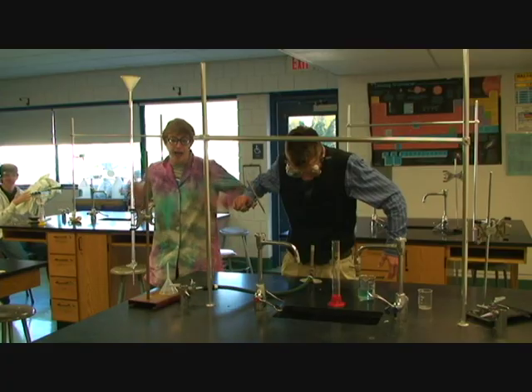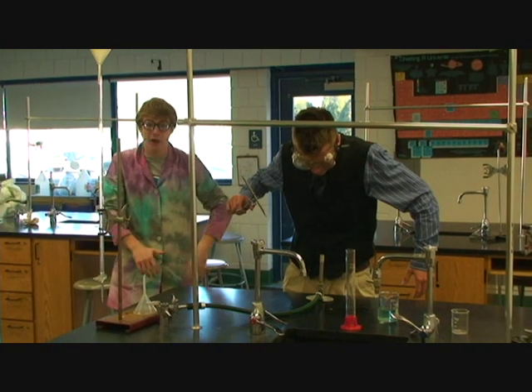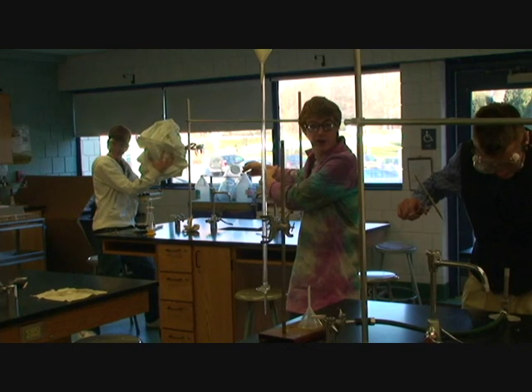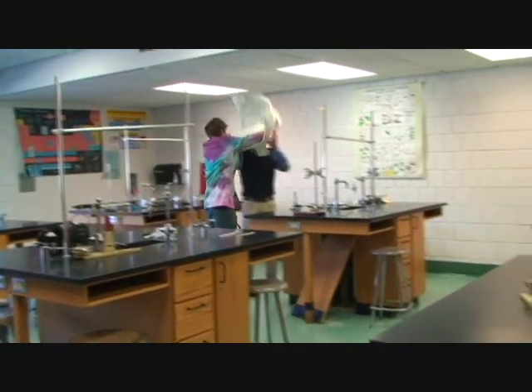As you can see, our student here, Jamal, is on fire. And he needs a fire blanket. So, you should have another student assist you, Ralph over there, throw you the fire blanket. Ralph? I have. Oh, the fire blanket.